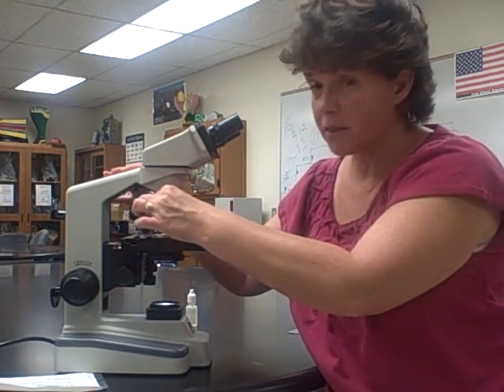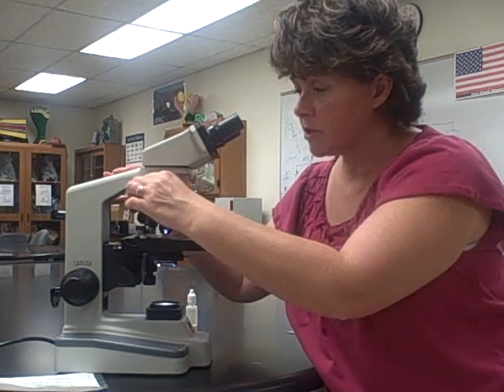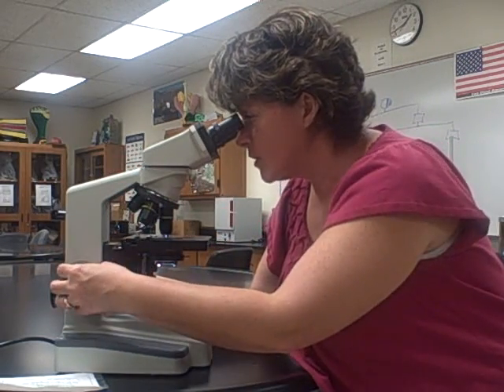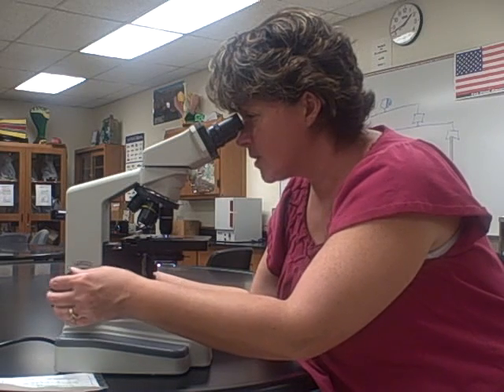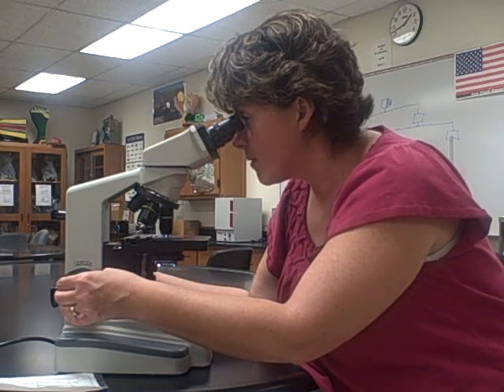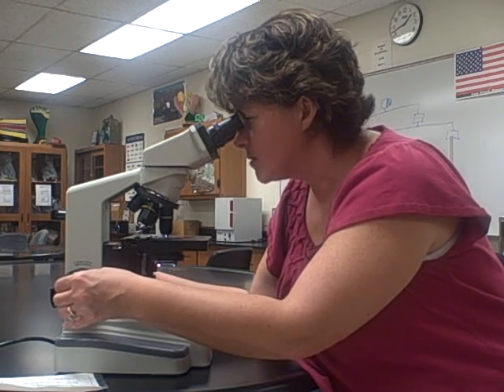Once I've focused under the 10x, I can go to the 40x. Notice I'm not pulling on the objectives — I'm turning using the revolving nosepiece. Now that I'm under the 40x, I will not use the coarse adjustment; I can only use the fine adjustment knob to bring it into focus.